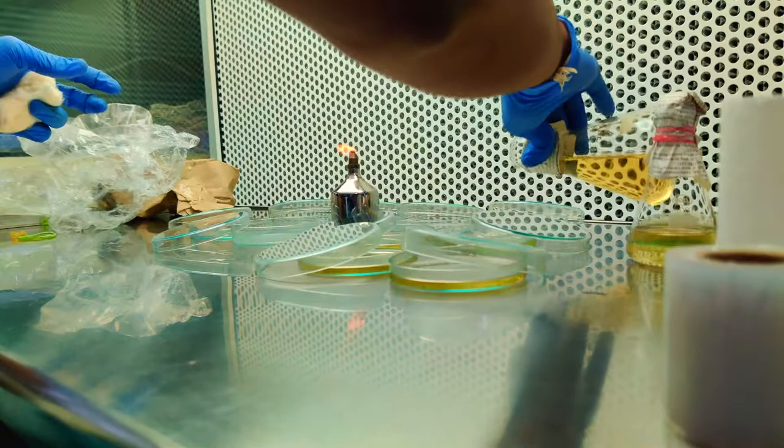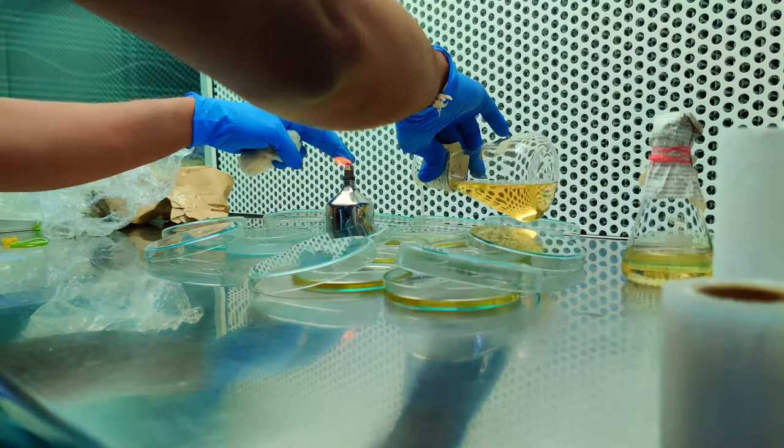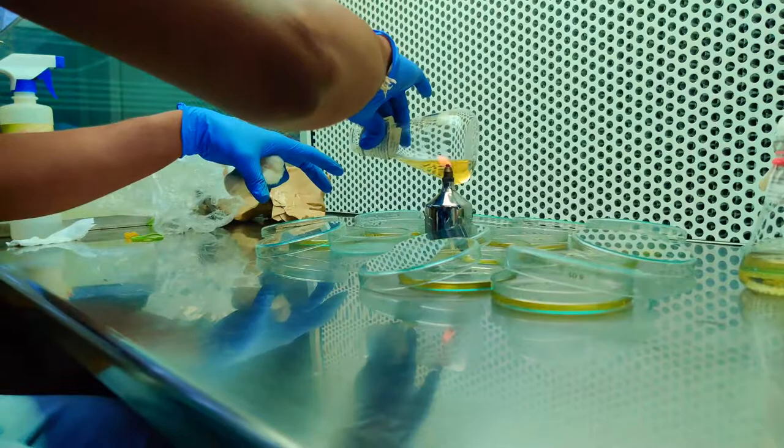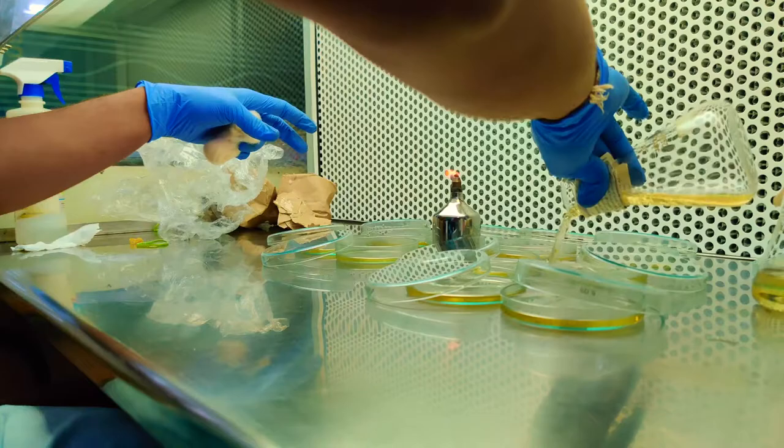You can calculate accordingly. According to the media they have given to dissolve, the same amount I have dissolved and am pouring. It will be stated on the media bottles which are sold by external companies, and it will be different according to each.